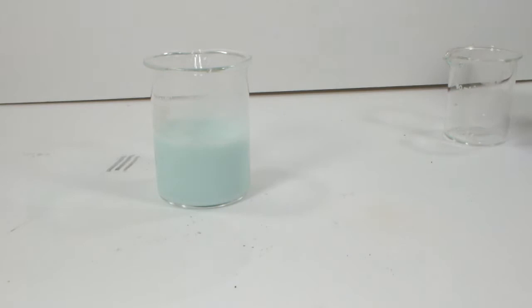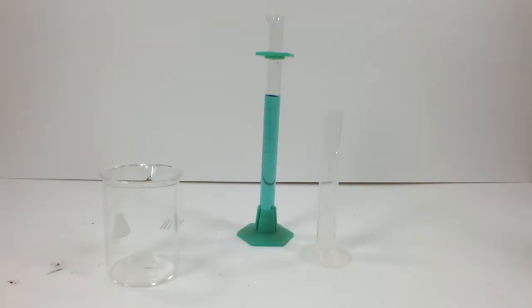I'm going to chill this down in the fridge for a little while to make sure I get the most barium sulfate to precipitate out as possible. It's probably unnecessary to do that, but I did it anyway.